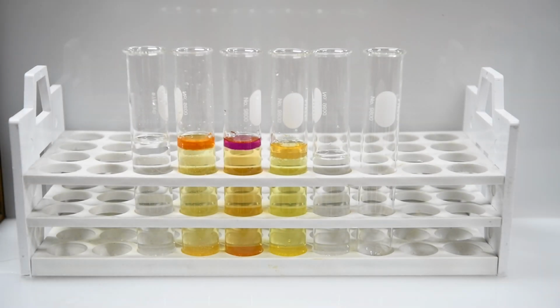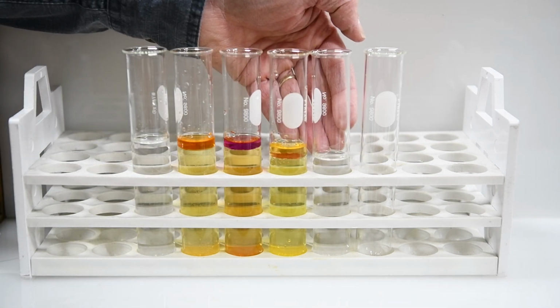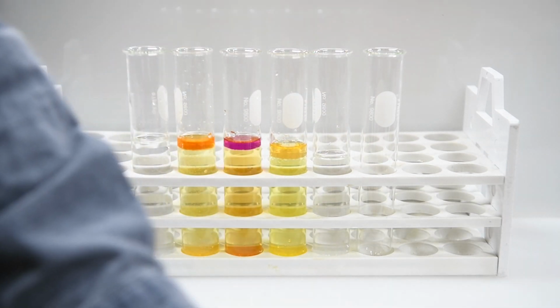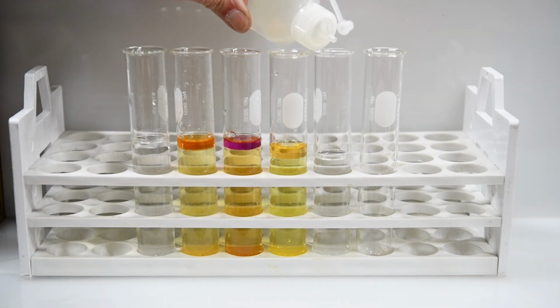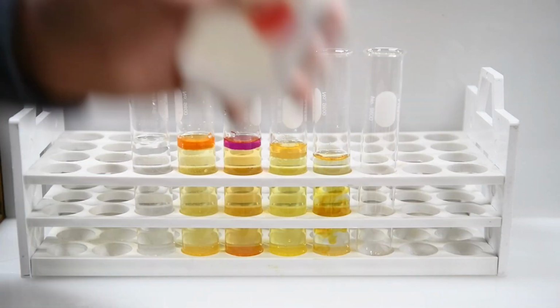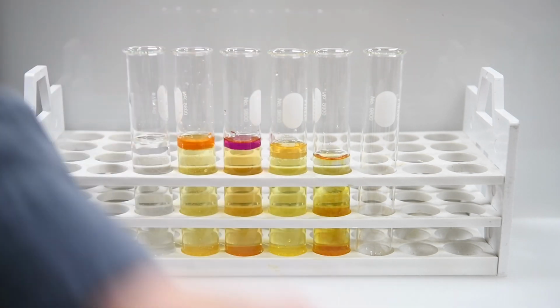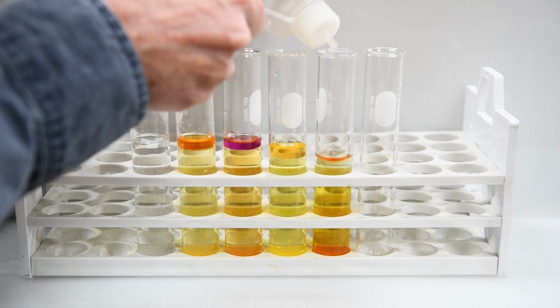All right, the next reaction is going to be potassium iodide and chlorine. So I've already filled this fifth test tube with the potassium iodide solution. So we'll add a few drops of bleach, our source of chlorine here. A couple of drops will probably be fine. 1 drop of hydrochloric acid to activate it. Ooh, looks like it's getting very colorful. And then we'll add some hexane to the top of that so we can see the color better.